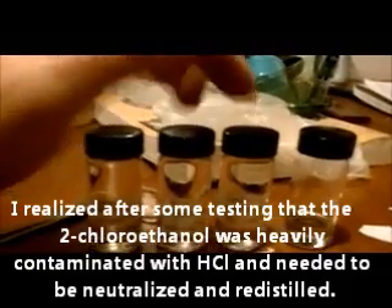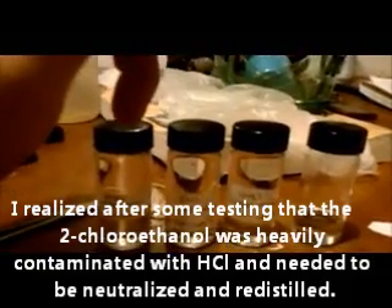Here's the vessel after pulling off everything below about 135°C — there's still some ethylene glycol in there. Here's what I ended up with: a fraction between 100–105°C, one between 105–109°C, one between 110–123°C, and then between 127–133°C I pulled this off, which is probably the purest. As you go down the fractions, there's probably more water content, so I'll need to figure out a way to purify these.